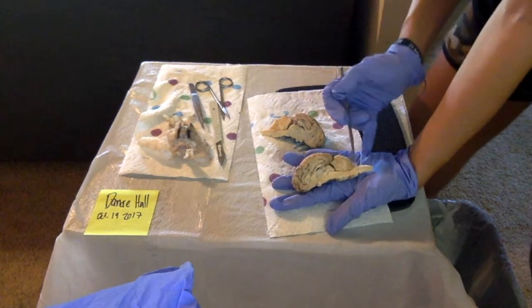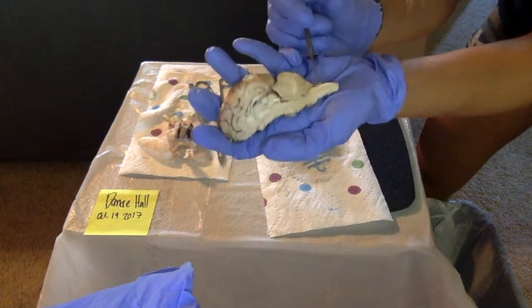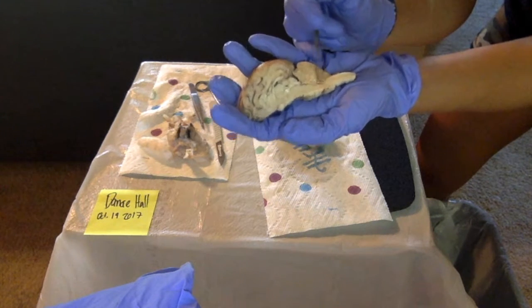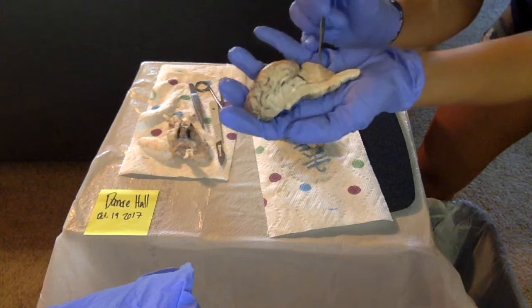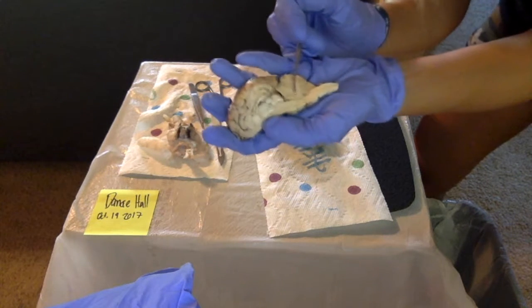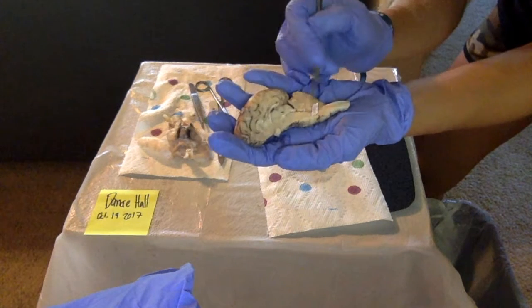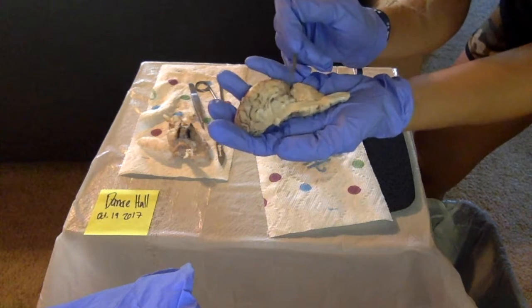So right here we have the spinal cord, and right in the middle of that, the darker piece is called the central canal. And then right above that is the medulla oblongata. Right on the side of that is the cerebellum, and in the middle of that, which is the white part, is white matter called arbor vitae. The pons is right here. It kind of sticks out more than the rest of the bottom part right here. We've got the pons. Right above that is the midbrain.